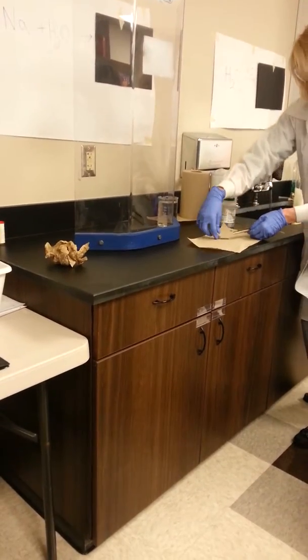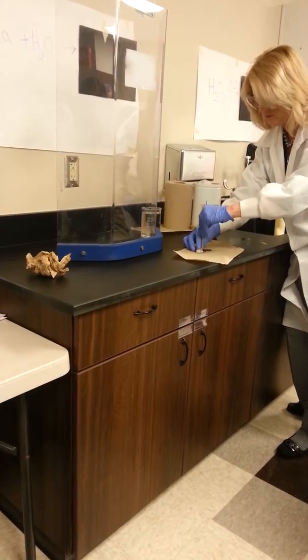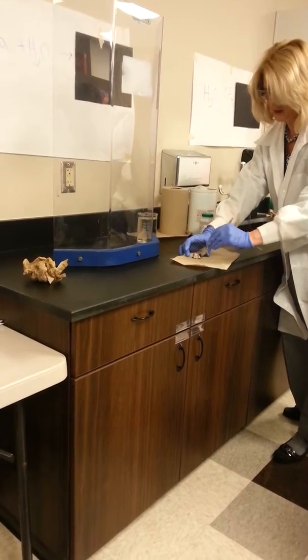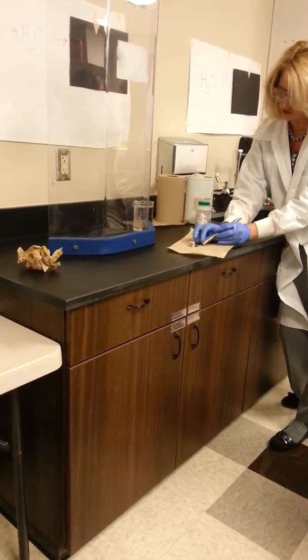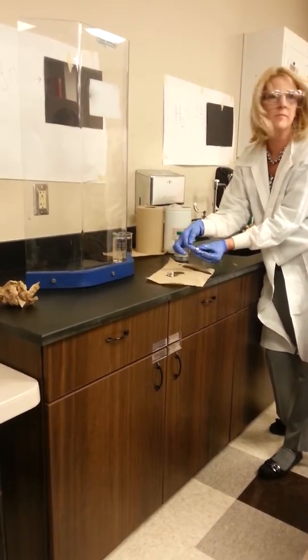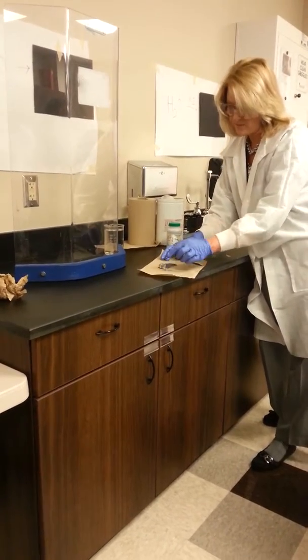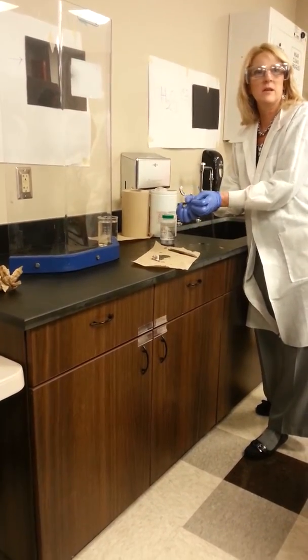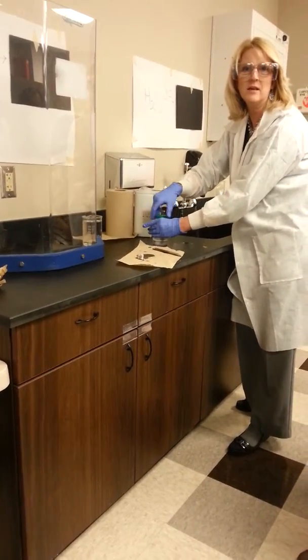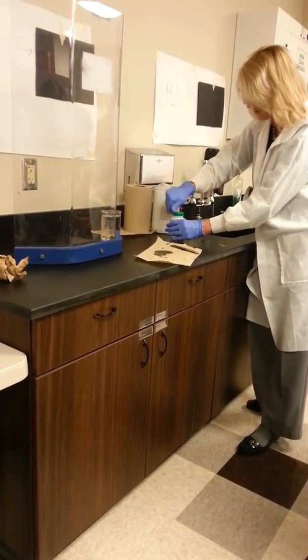Don't worry, it's covered with oil, as you can tell, so it's not real reactive for us right now. Okay, and I'm going to cut off a piece. When I cut that off, notice how shiny it got? That shows the luster and the shiny characteristics of a metal. But as it's exposed to air, it'll very quickly turn whitish, and it's more clay-like in texture. It's kind of like Play-Doh. Not that I should let my kid play with it, as you'll see why here in just a second.